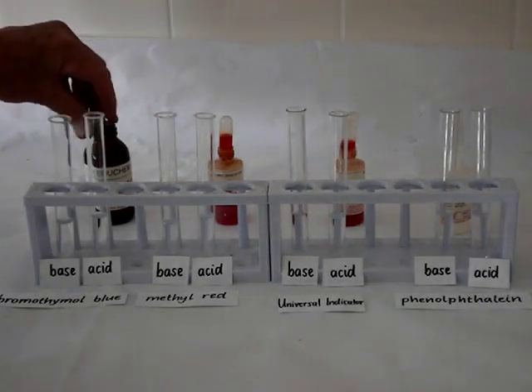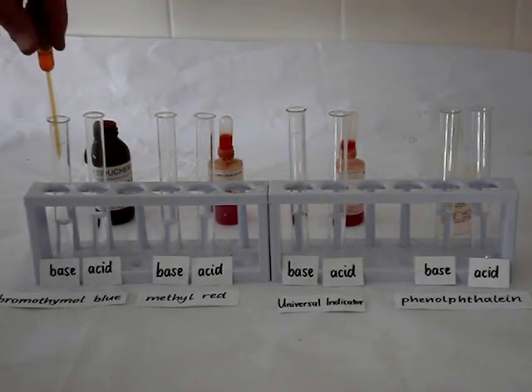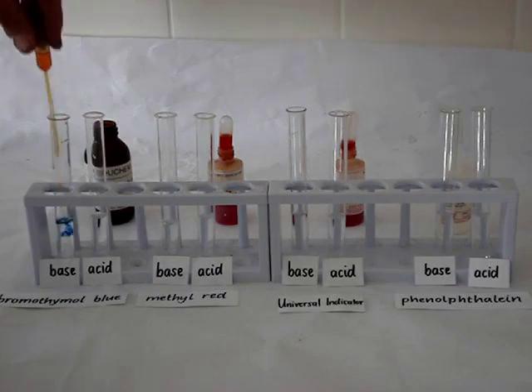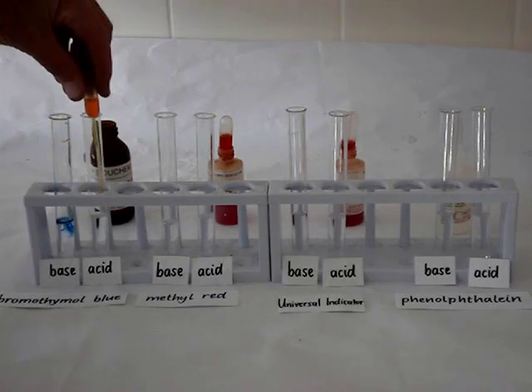So we start off with bromothymol blue and add a bit to a base. We see that it turns blue. In acid, it turns yellow.